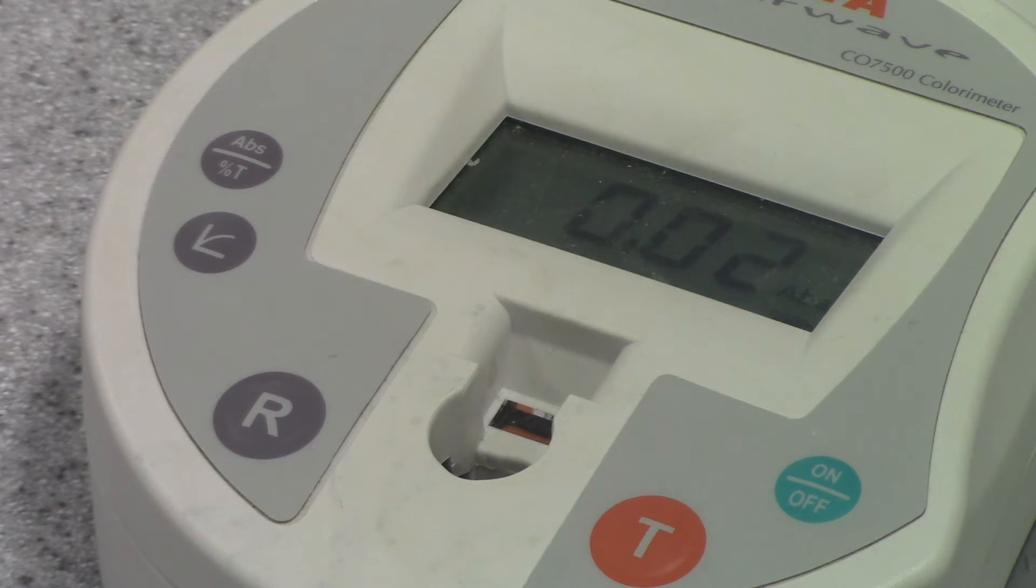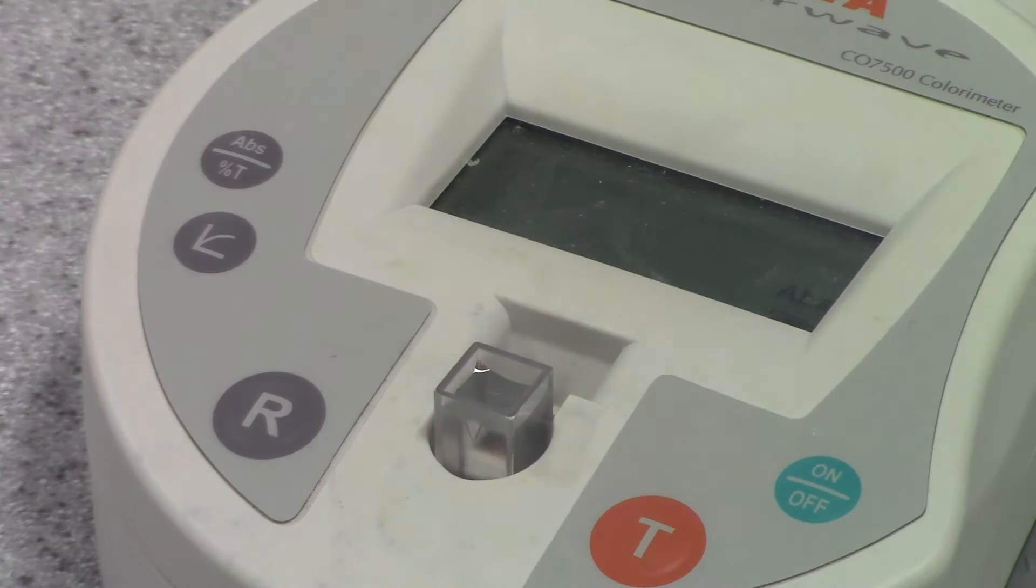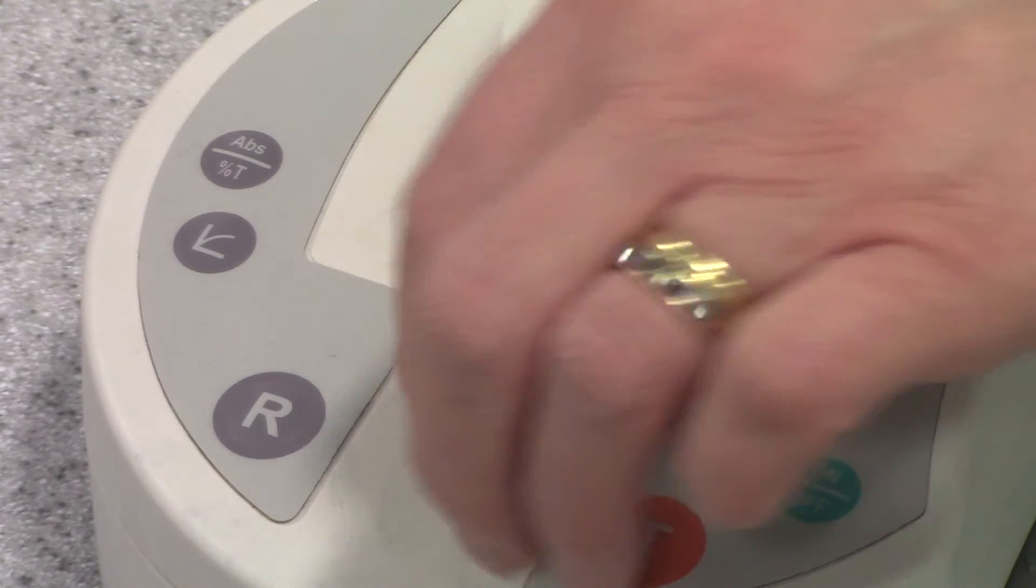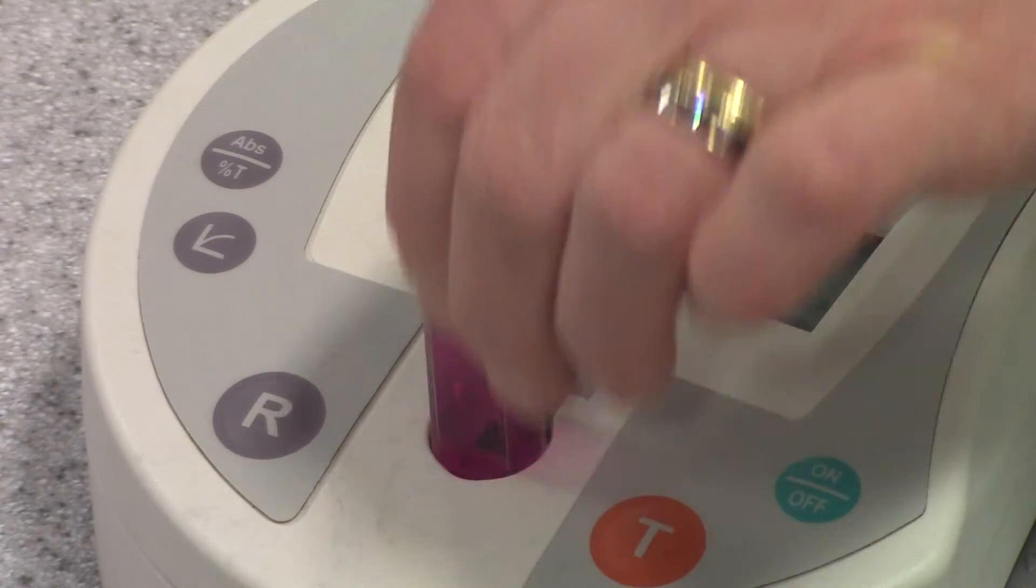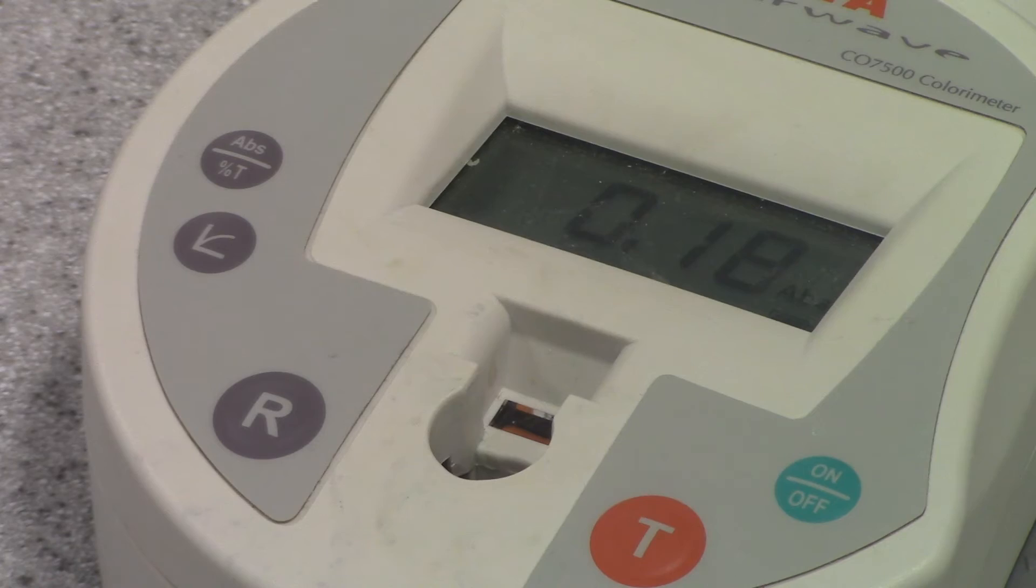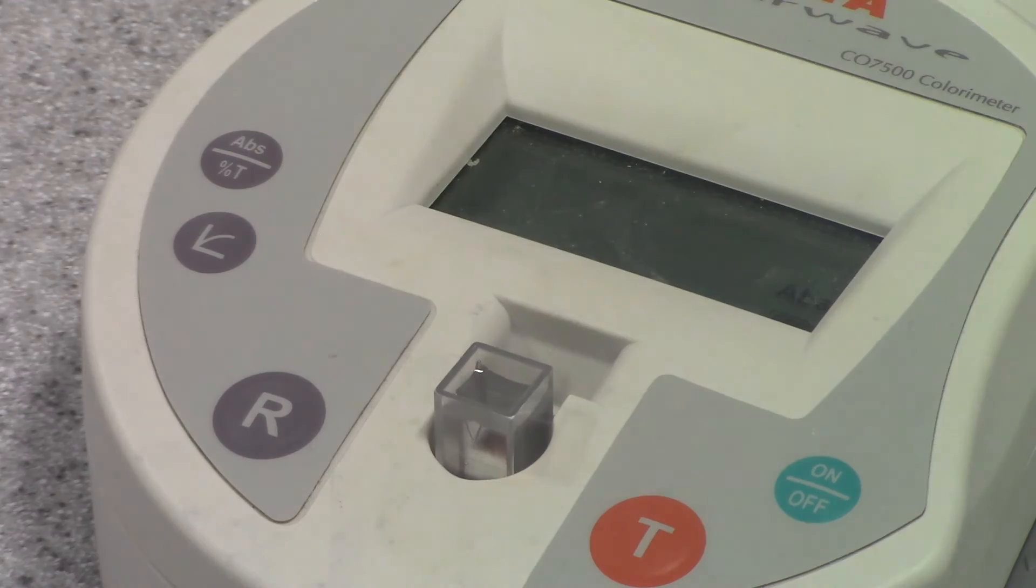I'm going to continue for my other solutions, making sure that I reference in between each one. My absorbance value should increase as my concentration increases. And I continue that for all my concentrations until I've got a full set of values.